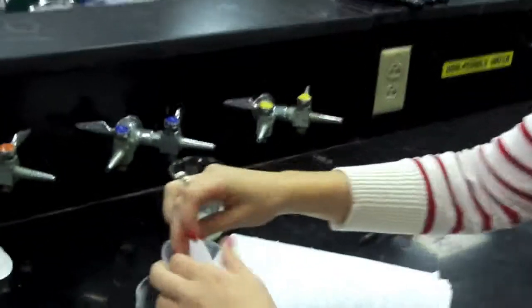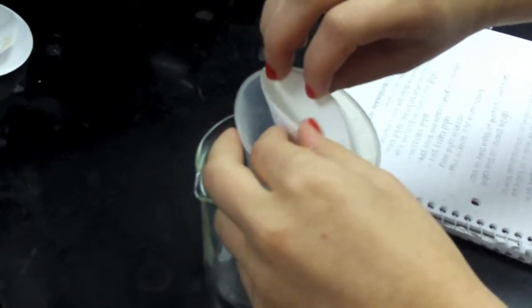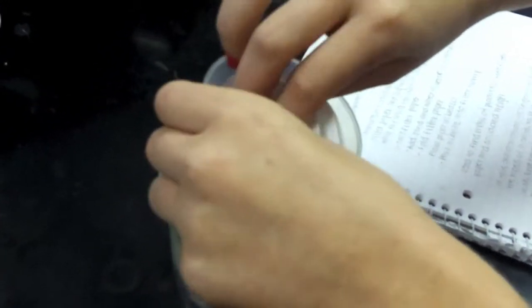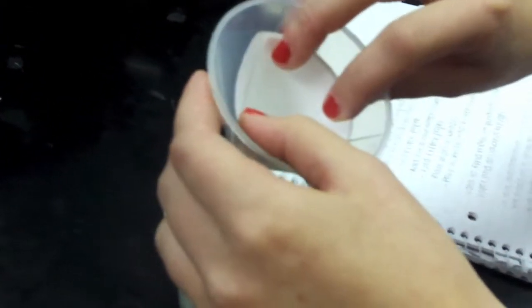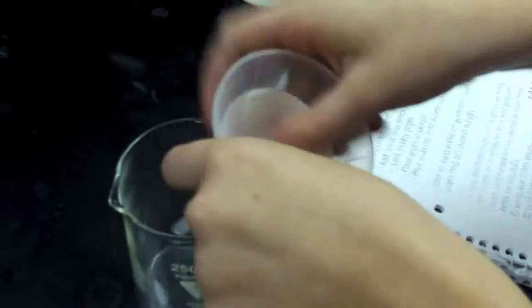Now it looks like this. Place it inside of the funnel like this. Don't pick right here, but grab one of these other folds so that there's no hole or creases that the solid could get through, and push it down into the funnel so that it'll stay.